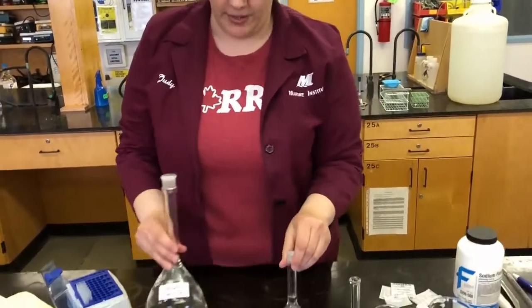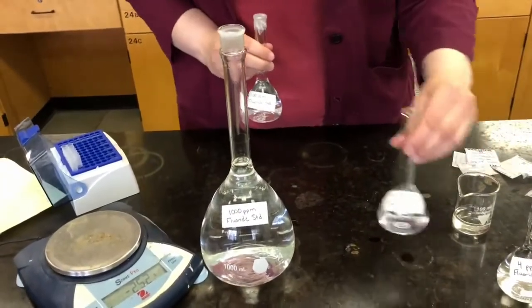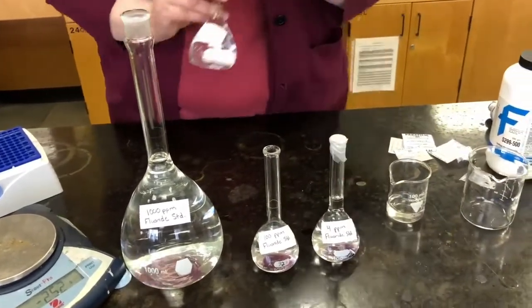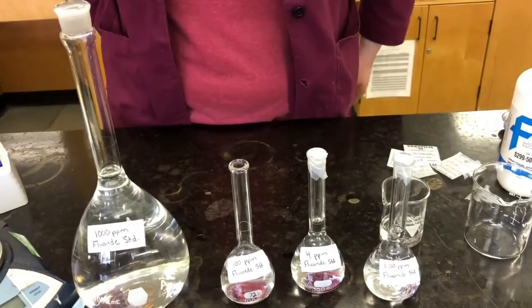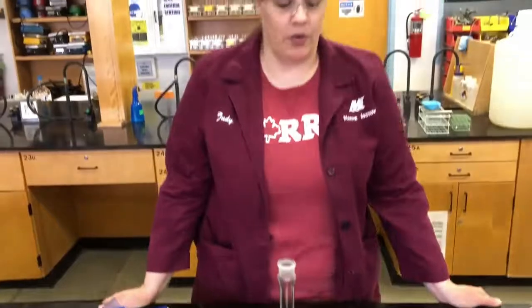So now you can see what we've done. We started with a 1,000 ppm solution. We diluted that down to 100 ppm, then to 4 ppm, and finally to 1 ppm. So we can use that same calculation for any final concentration that we're looking for to get a series of standards. Usually when we're doing an experiment, we do probably 5 at a minimum standards. Sometimes we do even more, but it's the same procedure to be followed for any substance, for any element that we're looking for.